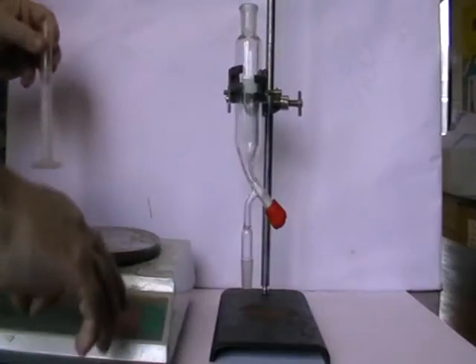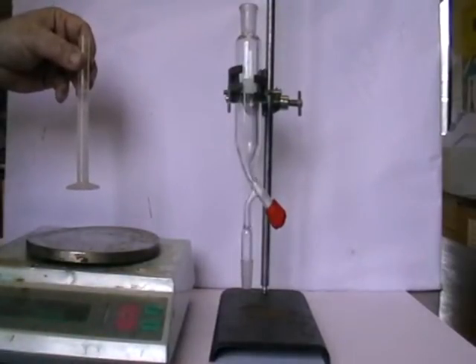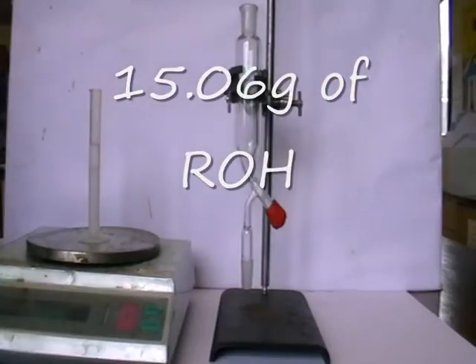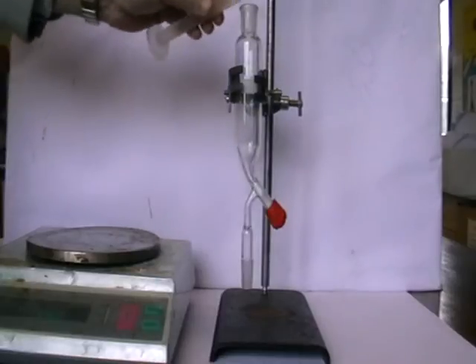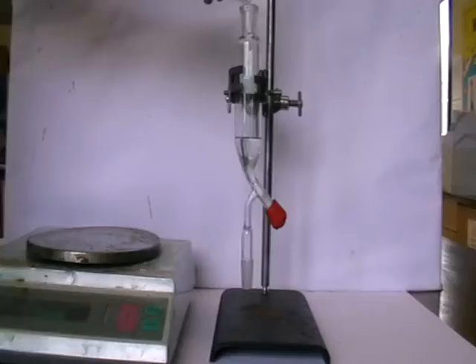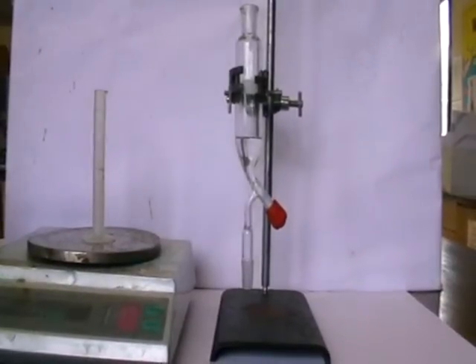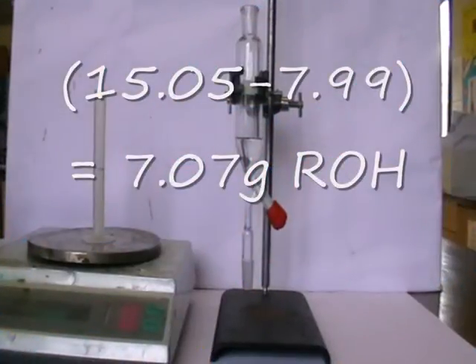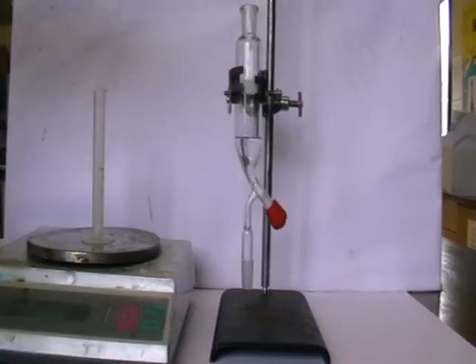I'm going to put it on a top pan balance now, just getting it to 0.0. Now it's reading 0.00, and we'll record that mass — that's 15.06 grams. I'm now going to transfer most of that to the separating funnel, and then record the mass of the measuring cylinder once again — that's 7.99. So we subtract 7.99 from 15.06, and that comes out to 7.07 grams. So I have transferred 7.07 grams of my alcohol into the separating funnel.